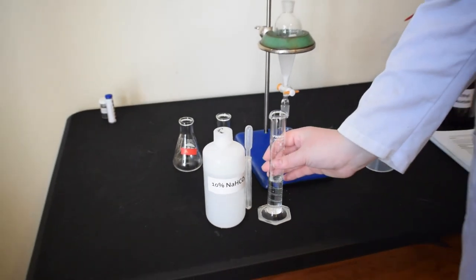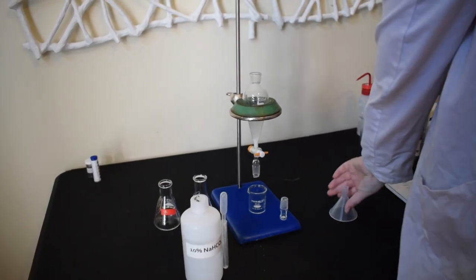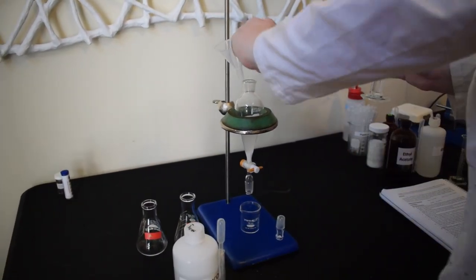Next, we are adding 25 milliliters of sodium bicarbonate to the separatory funnel.